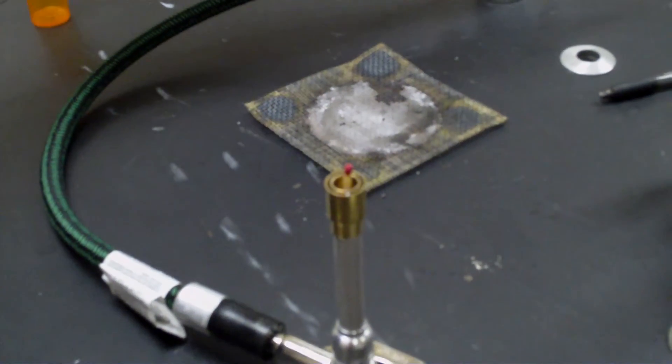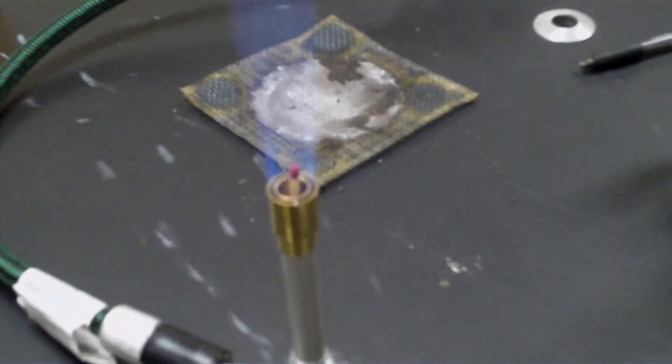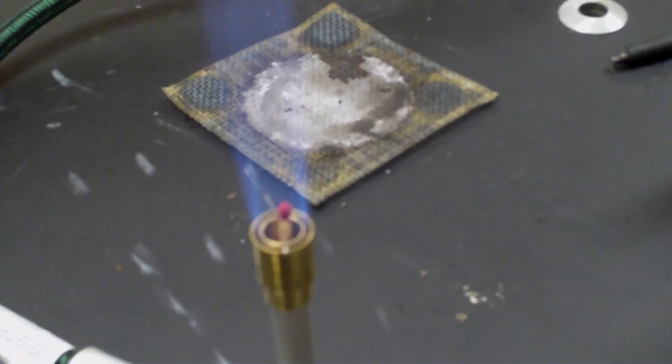Never want to let the gas just fill the room. And we see that the match doesn't light. We'll be right back.